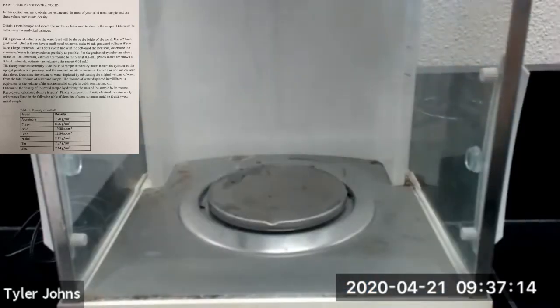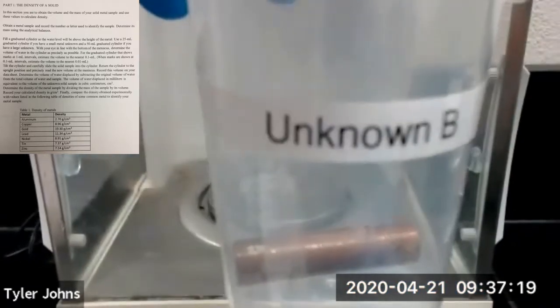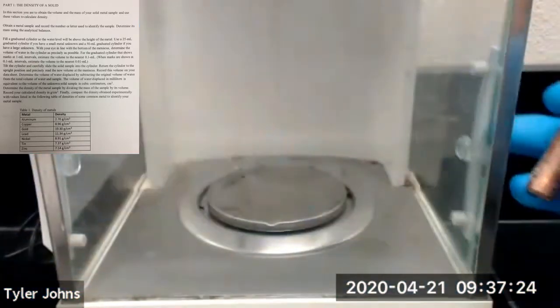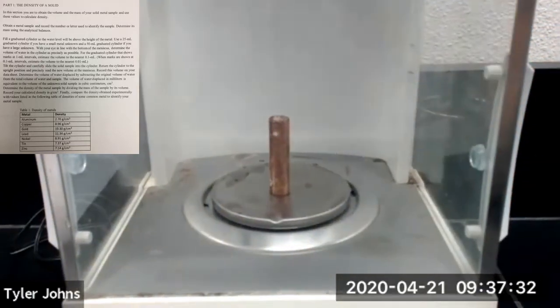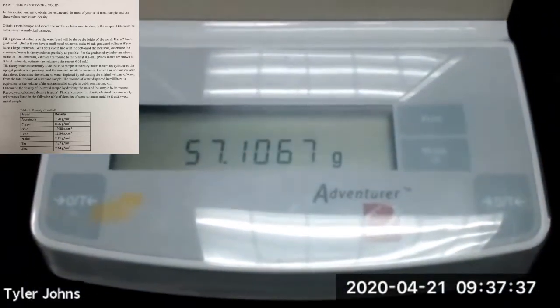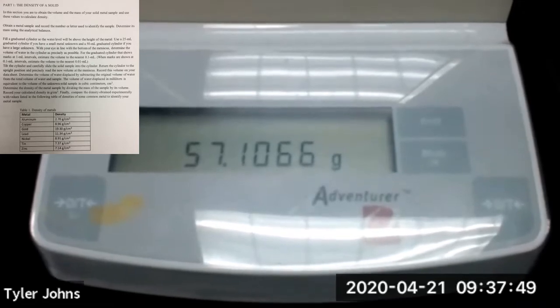Now we're going to determine the mass of unknown metal cylinder B. The mass of unknown cylinder B is 57.1067 grams, or 57.1066 grams.